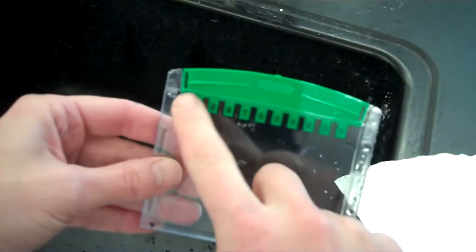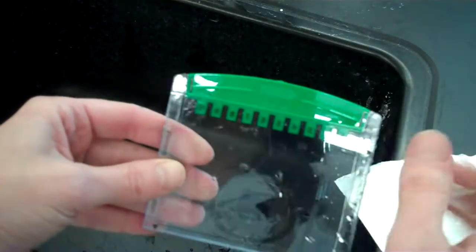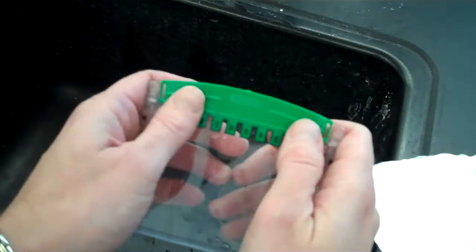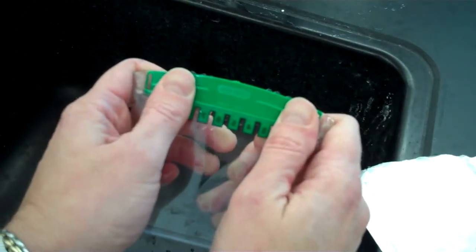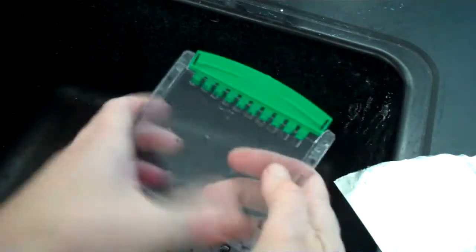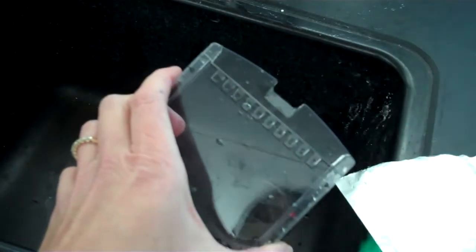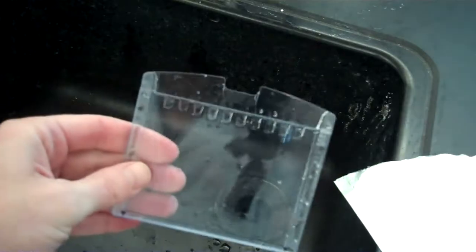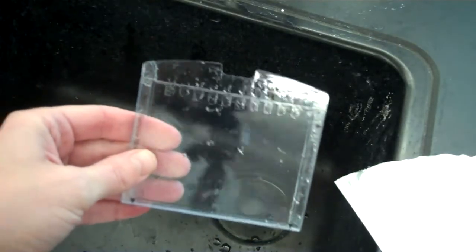The gel itself you'll see has a comb. And the next thing you're going to want to do is very gently lift the comb. Don't squeeze here or the comb won't come out. So I've taken out the comb. The comb is disposable and can be thrown away.